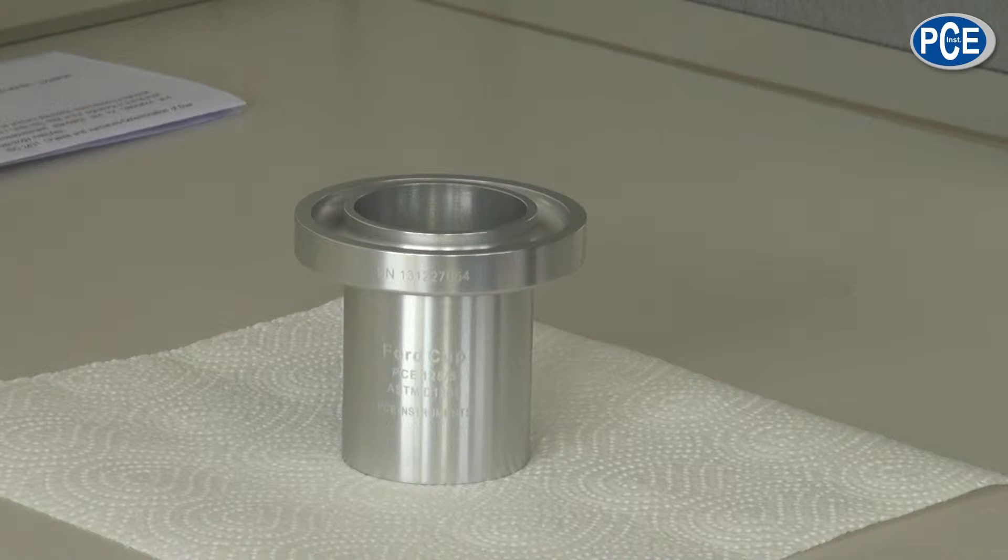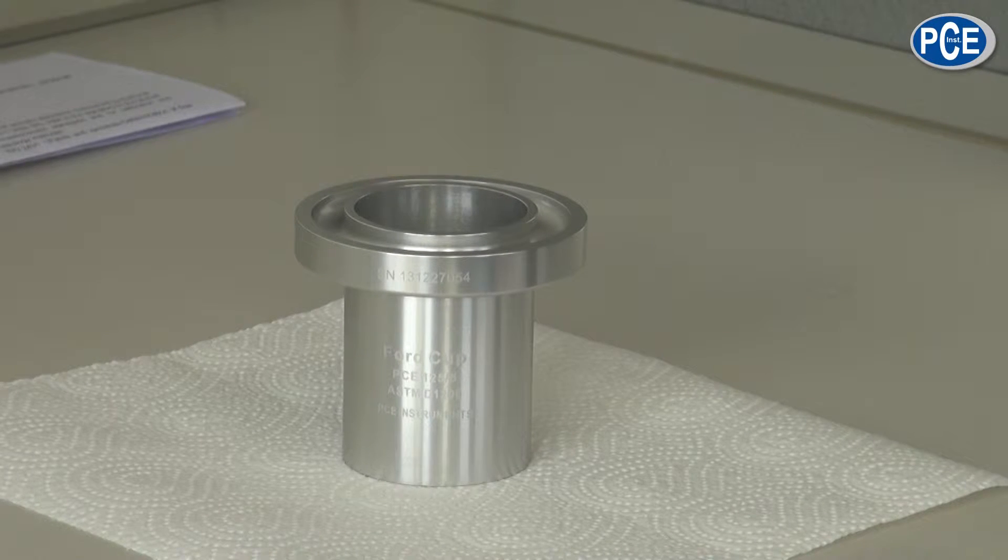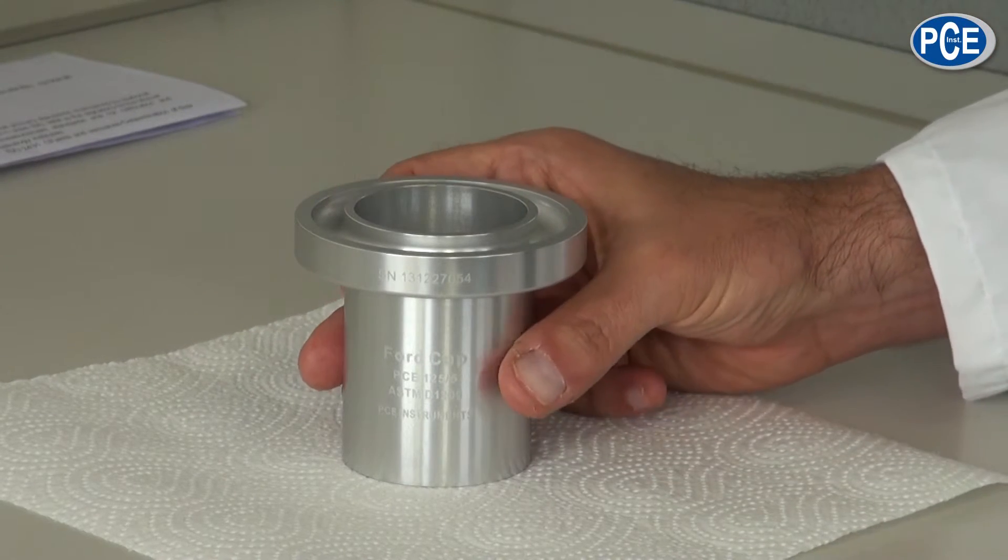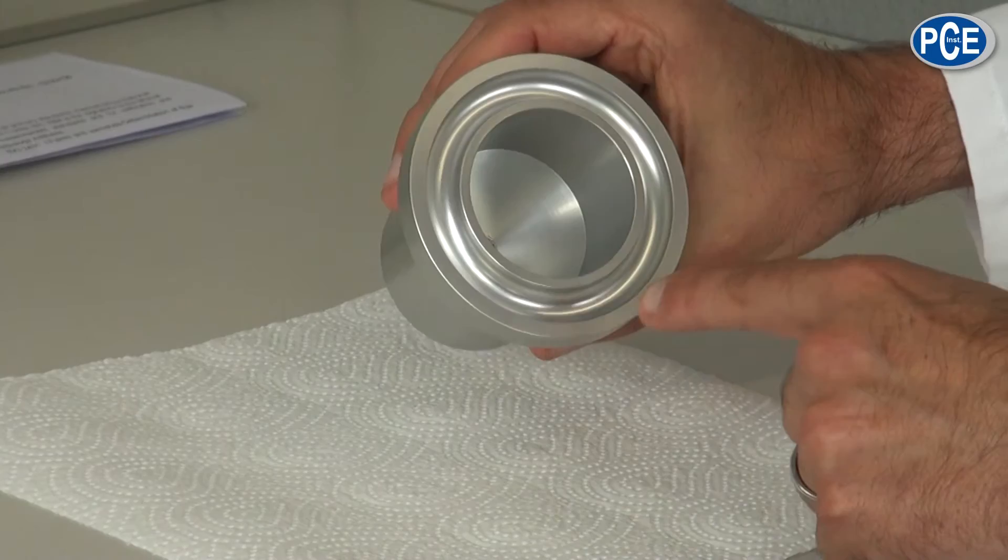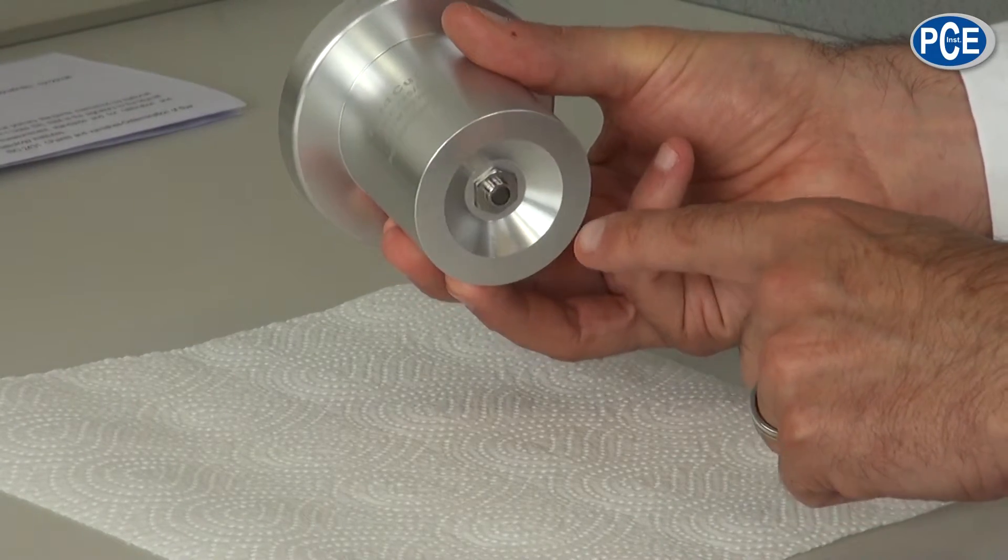The Ford Flow Cup PCE 125 is used to measure the viscosity of low-viscosity fluids. The Ford Flow Cup is equipped on the top side with an overflow rim and on the base an individual outlet nozzle.